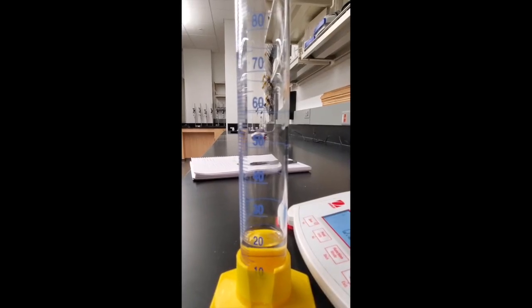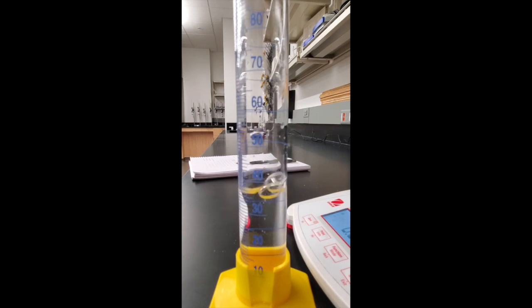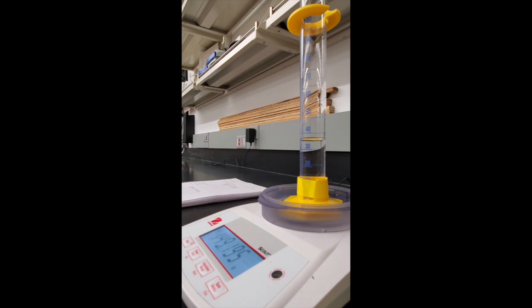More of solution A is added. The new volume is 35.5 milliliters. The mass is 149.195 grams.